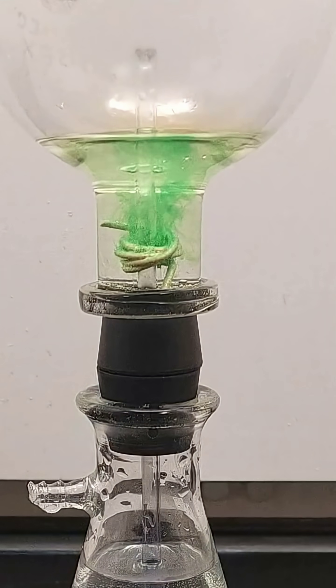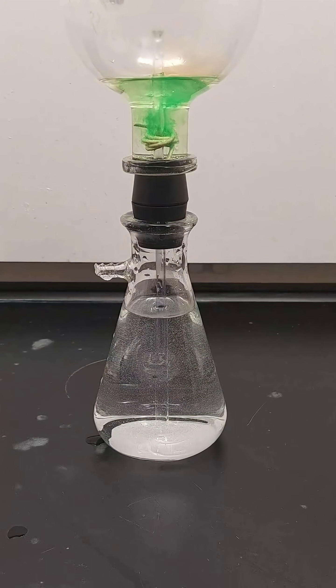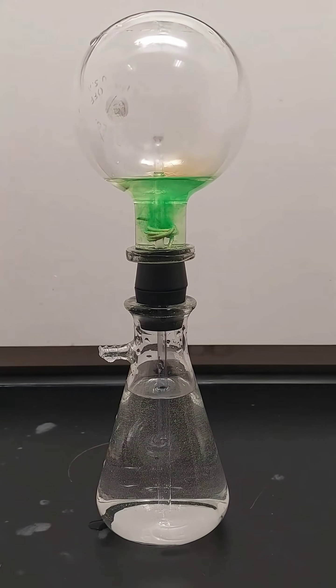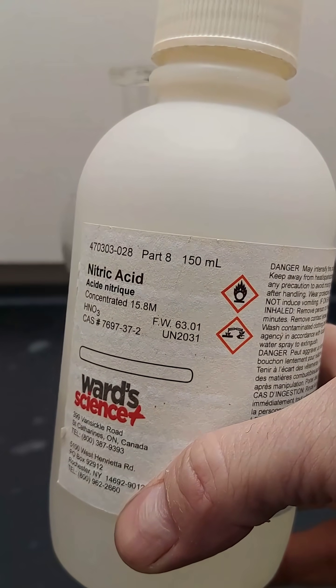Hi everybody, Chem Class Rules here. Today we'll be taking a look at the classic chemistry demonstration, the nitric acid fountain.